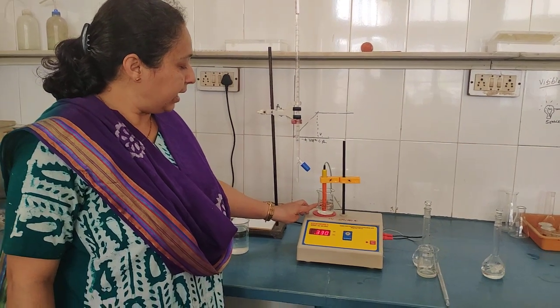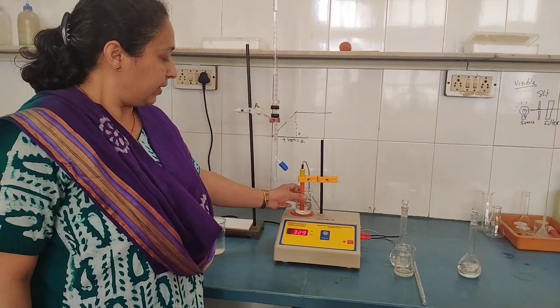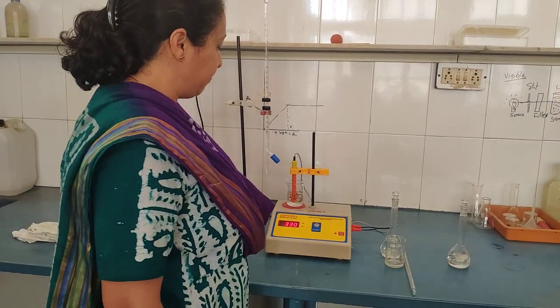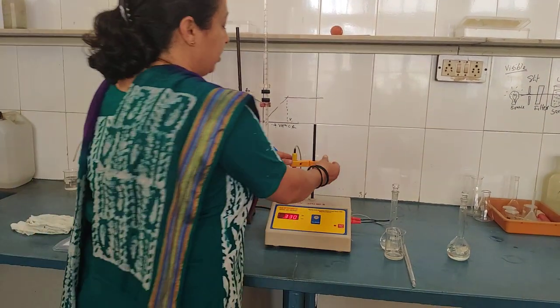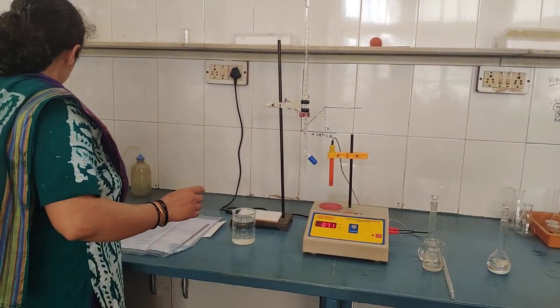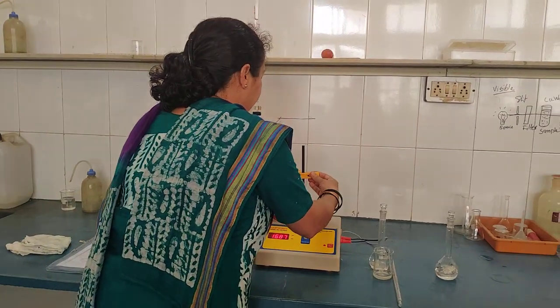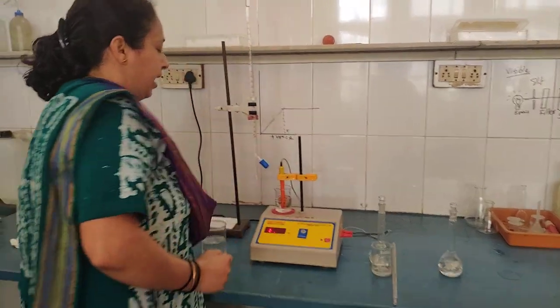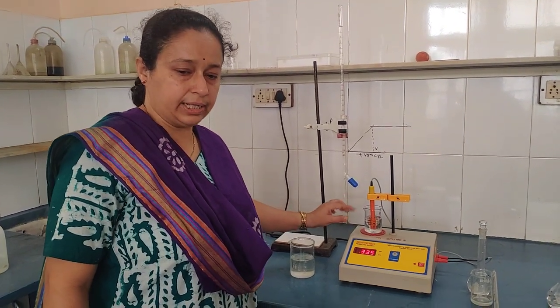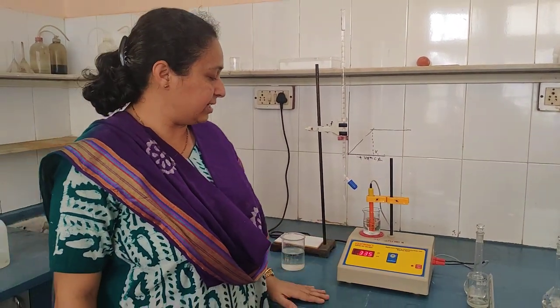This gives you the conductance of the solution filled in the beaker. First you have to wash the conductivity cell a number of times with conductivity water. I will show you how — remove the water, add new conductivity water, and dip your conductivity cell in it. Repeat this process 4 to 5 times so that traces of any previous solution are completely removed.